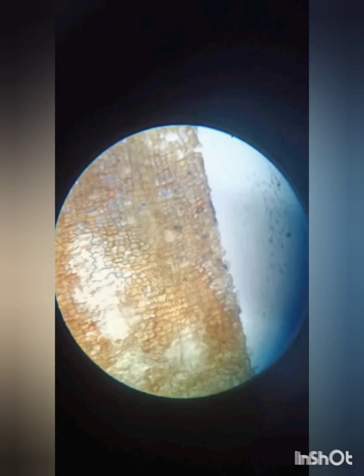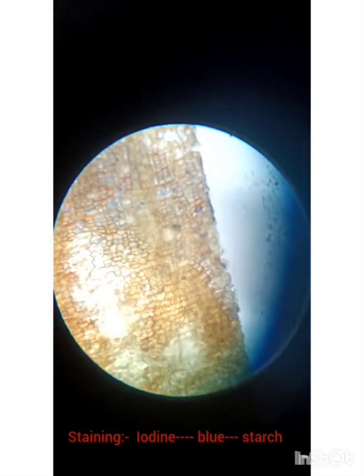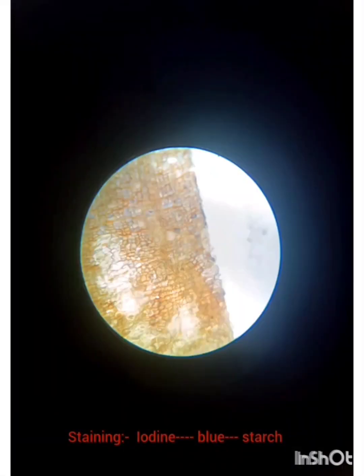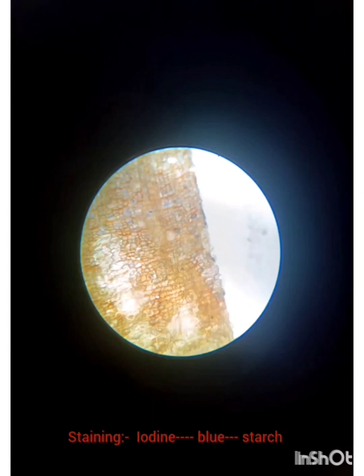This is the transverse section of cinnamon bark after staining with iodine solution. It shows a blue color, which indicates the presence of starch.